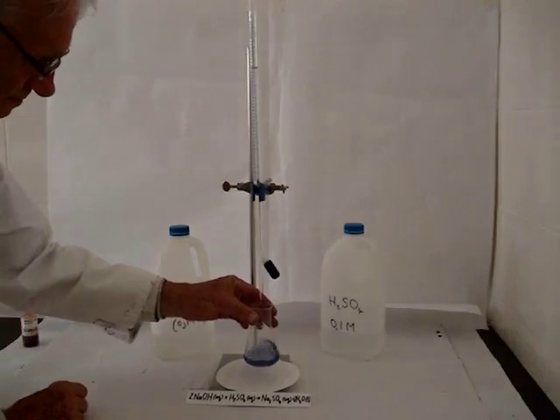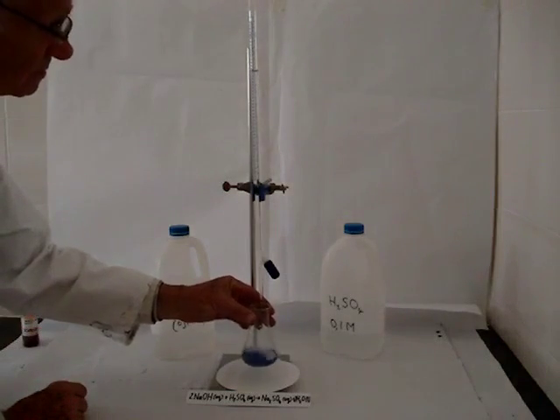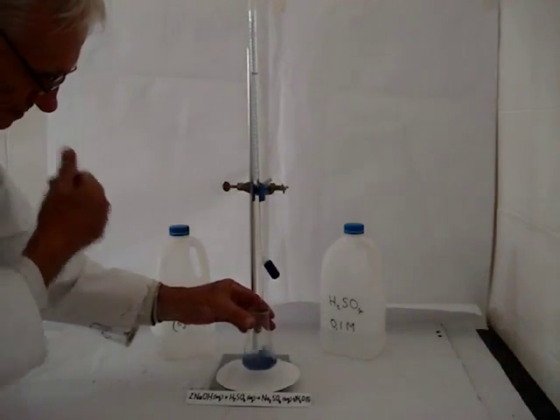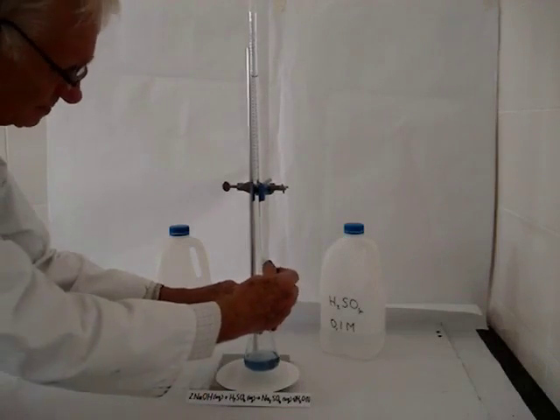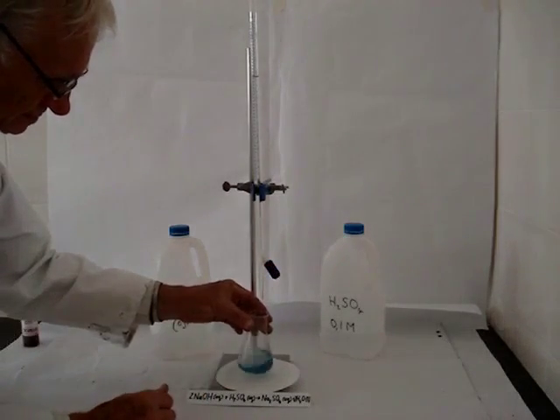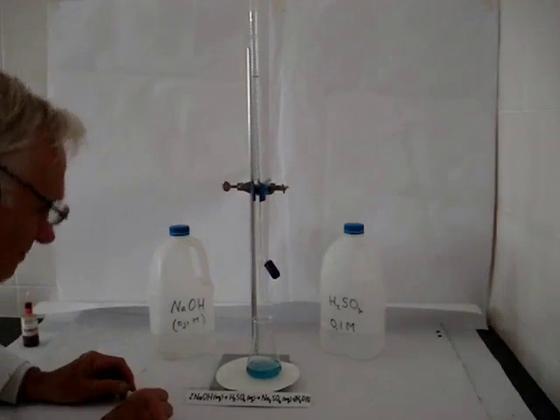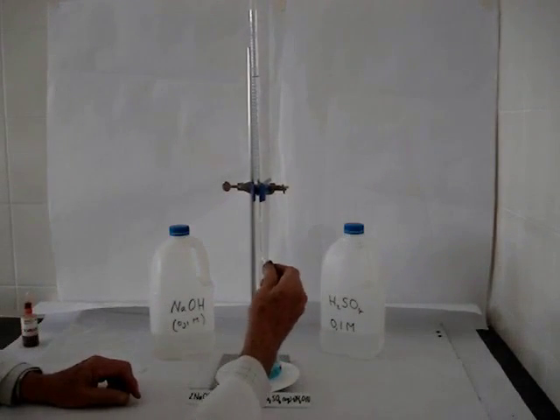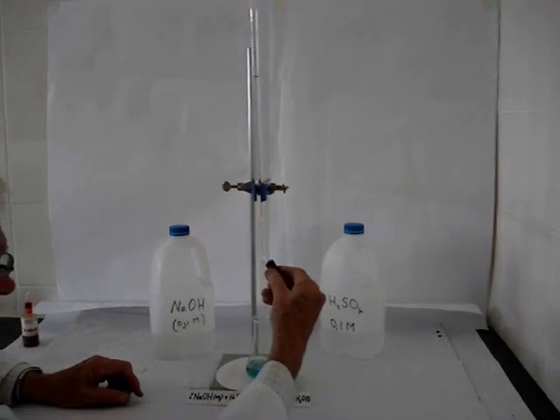then the entire volume will turn green, because at that point we won't have either acid nor base present, but rather only the salt, sodium sulfate present. And we're just about there, almost at the green color.